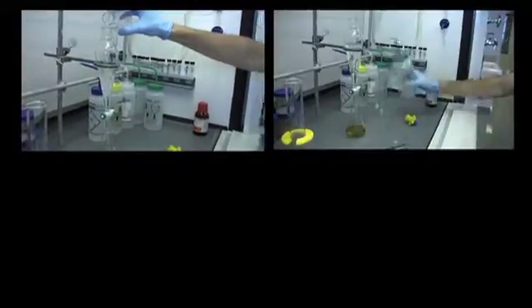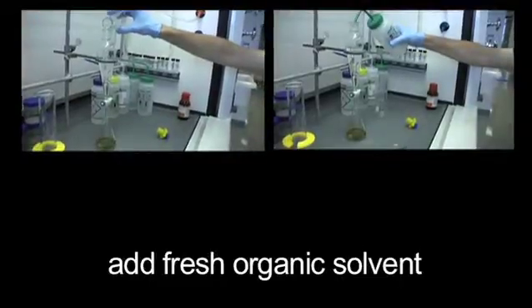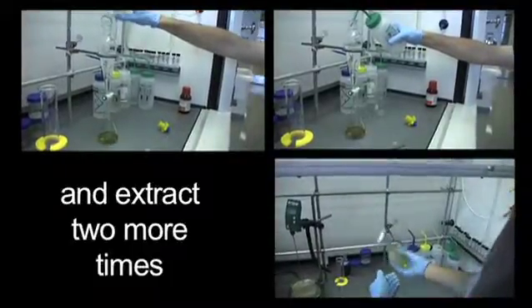Pour the aqueous layer back into the separatory funnel. Add fresh organic solvent and extract two more times.